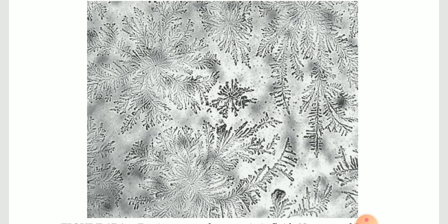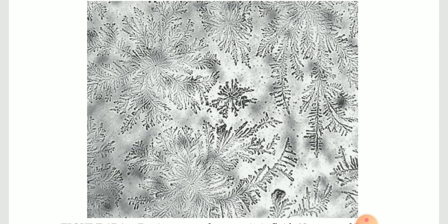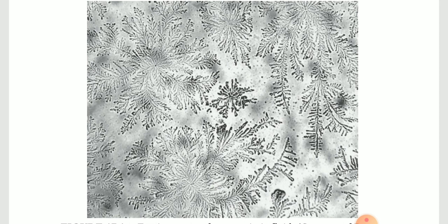So if the secretion is highly branched like a fern leaf, we can say it is amniotic fluid and there is a chance of rupture of the amniotic membrane. If the amniotic membrane ruptures, the fluid comes out, we take the sample, and it will give a fern-like appearance.